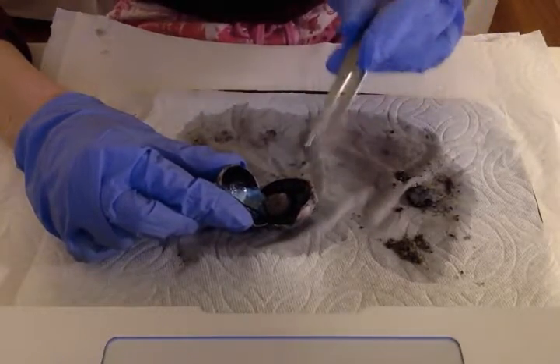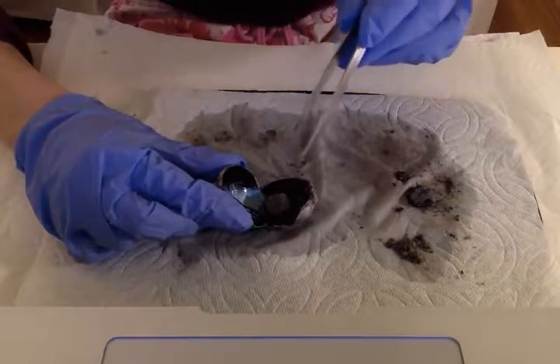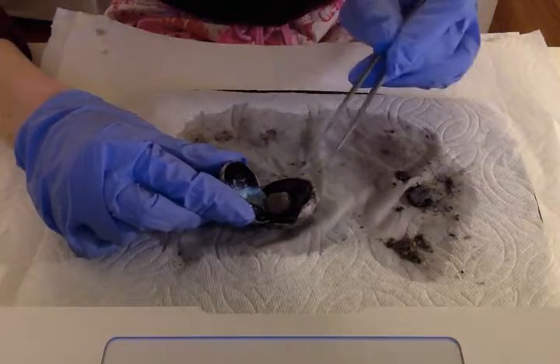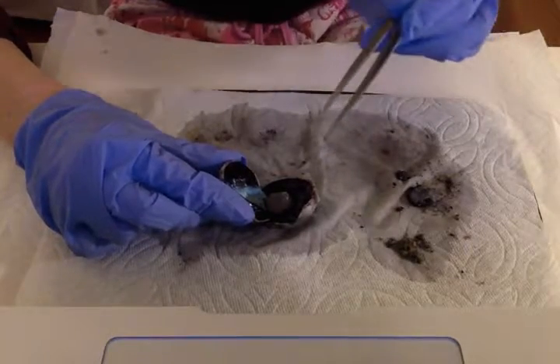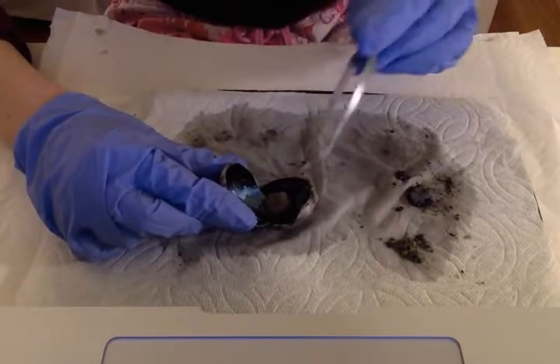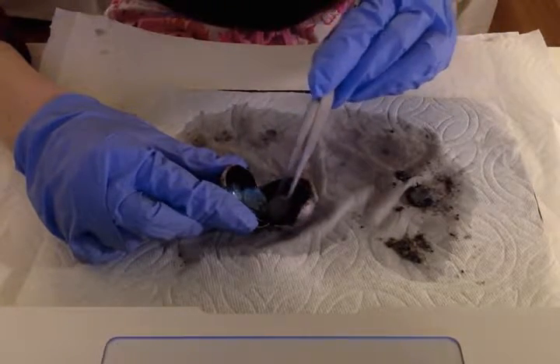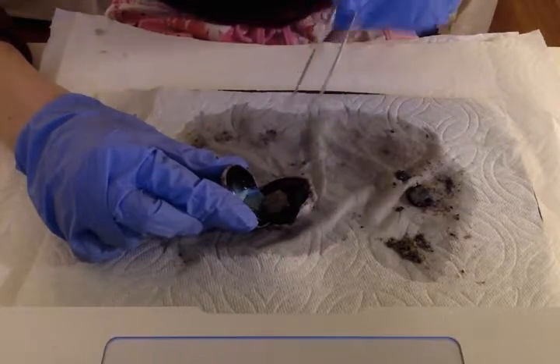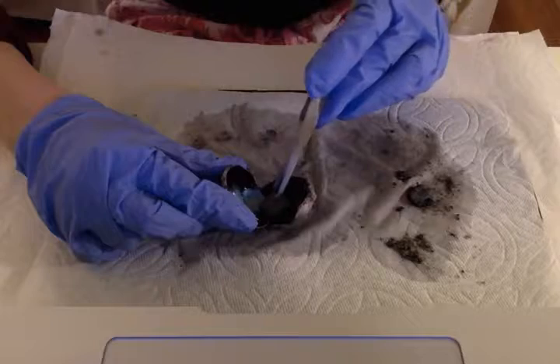Now this is important because changing the shape of the lens is going to alter the path of the light rays, which changes the focus of the light and ultimately the focus of the image that's seen at the retina in the back of the eye. So when someone has cataract surgery, the surgeon is replacing this cloudy lens with a clear plastic one. So I thought that was really interesting.